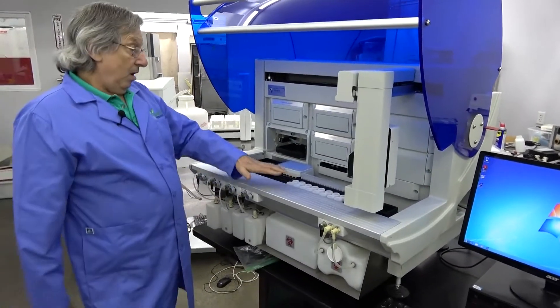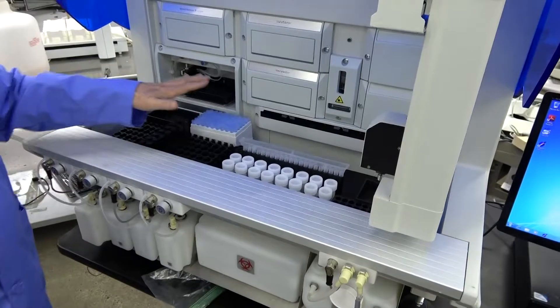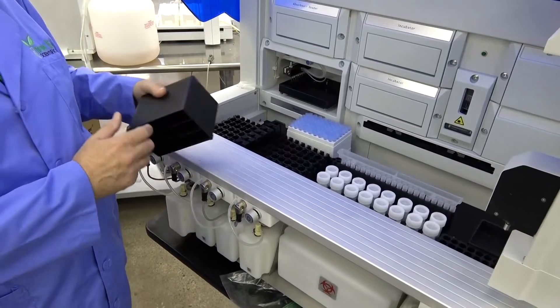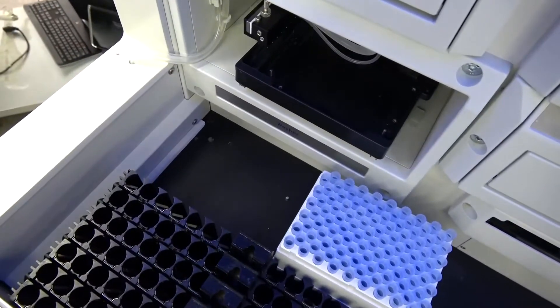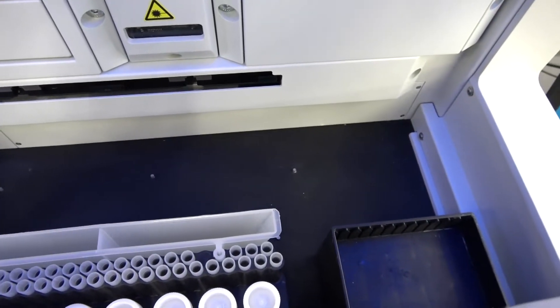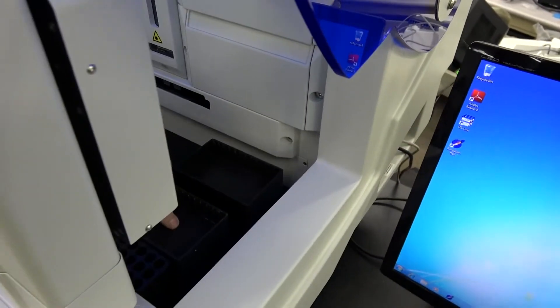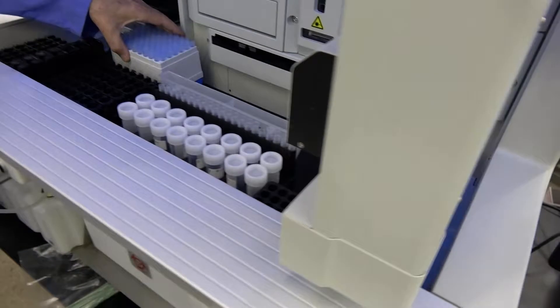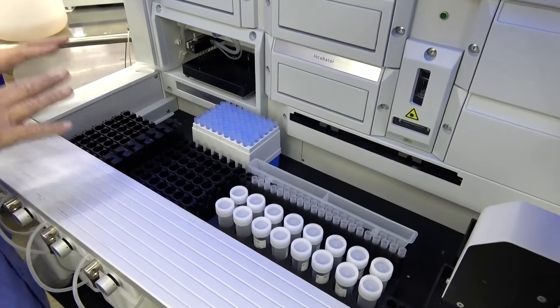So you get your unit — it's sometimes a good idea to run it the first time without any deckware in it. Deckware has location pins that meet pins on the deck itself. There are only certain places that certain pieces of deckware can go — this piece can go in this position, but not that one; it can go in this other position. All of them have particular places. Be sure your units are locked in, but for your initial test you'd probably want to run it without any deckware involved.